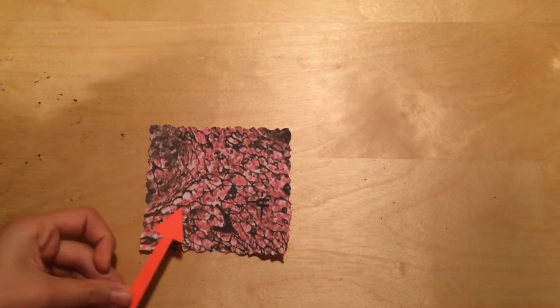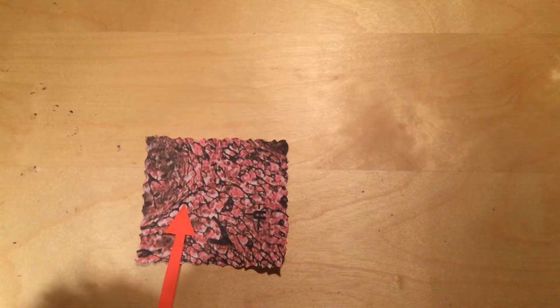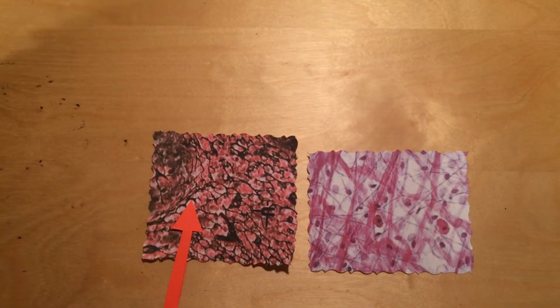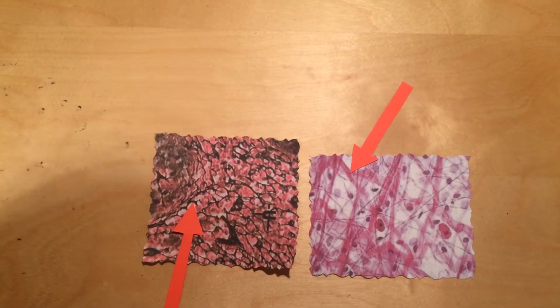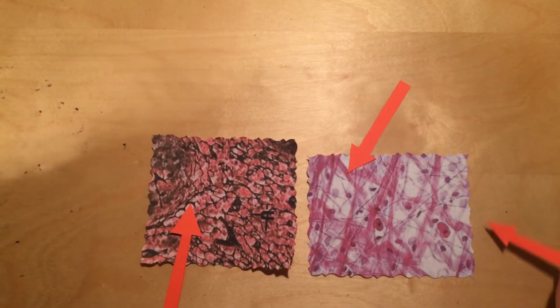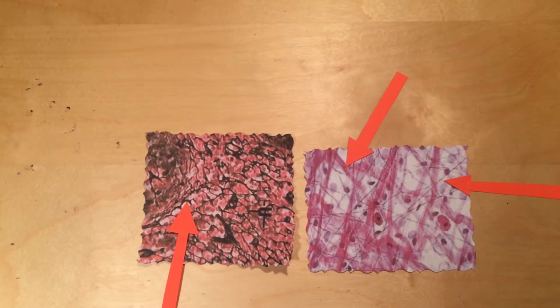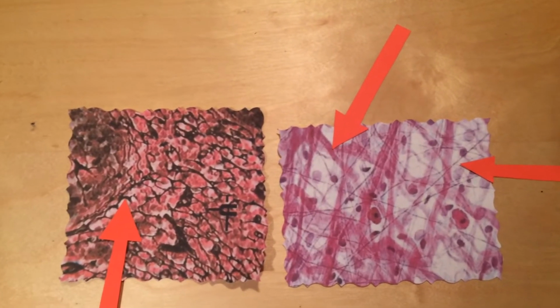Reticular fibers are thin, dark, and have a curly appearance to them. They supply support and strength for the cell. Collagen fibers mostly appear in the background, and they are thick and a medium tone. They function as strong, flexible, and numerous fibers. Elastic fibers are much thinner and very dark. They supply the strength and the stretch.